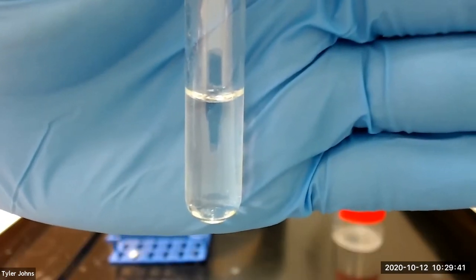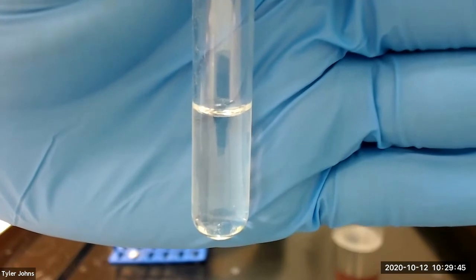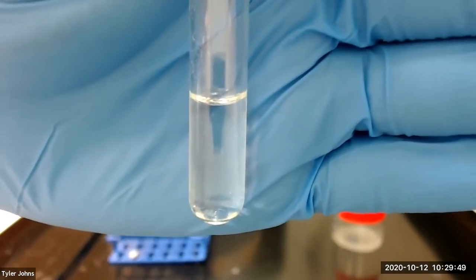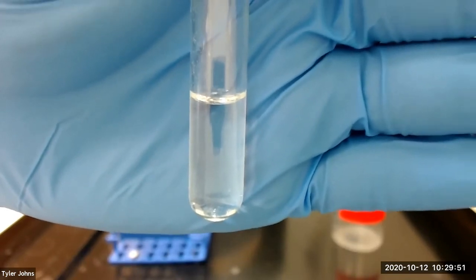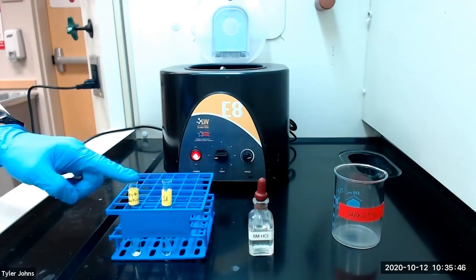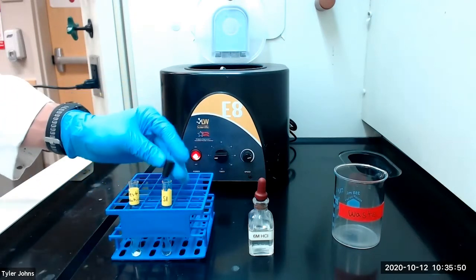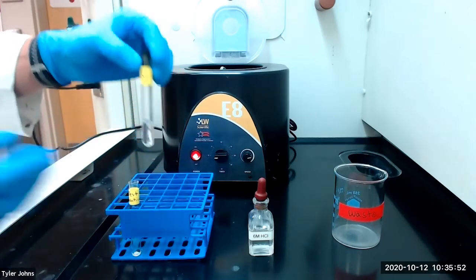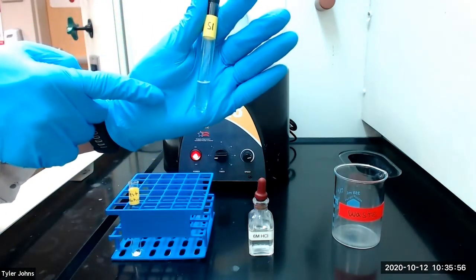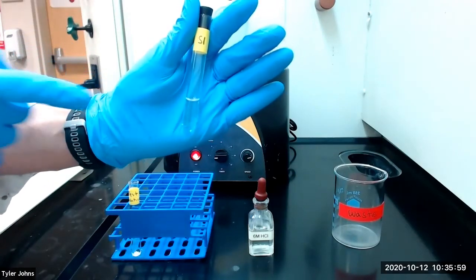We added a couple more drops of six molar hydrochloric acid and no more precipitate formed. Therefore, precipitation of the silver and lead ions is complete. If our starting test solution were to contain other ions outside of the chloride group, we would need to stopper our test tube with the S1 solution and save the S1 solution for further analysis of those other ions.